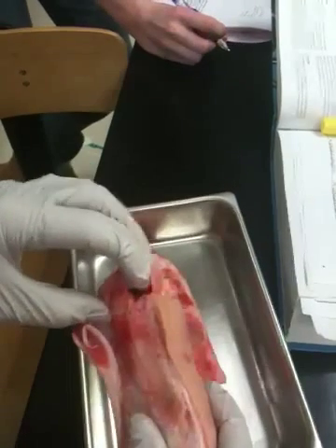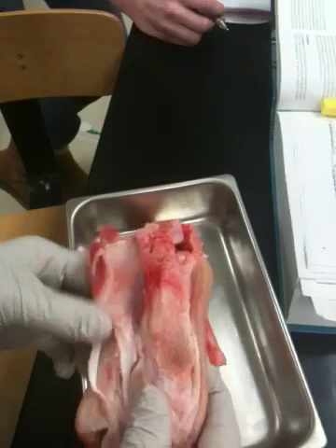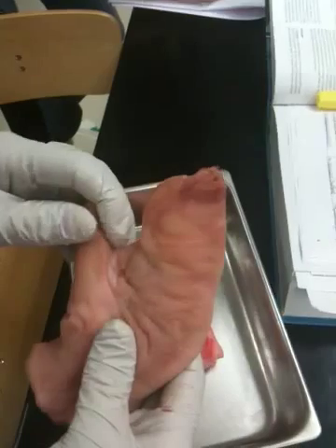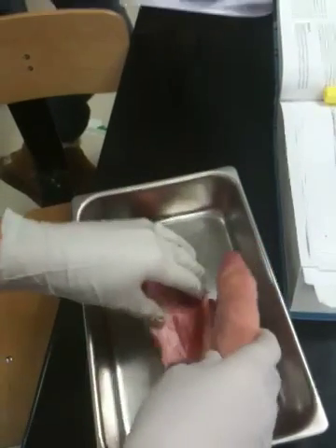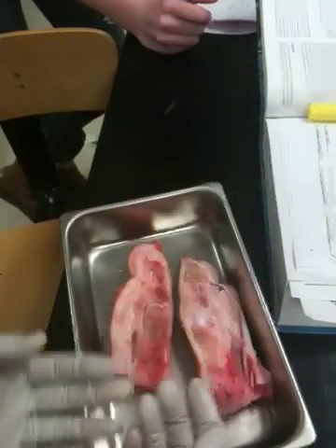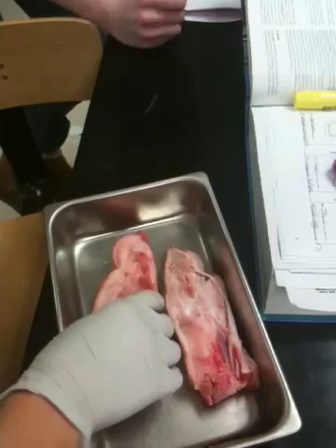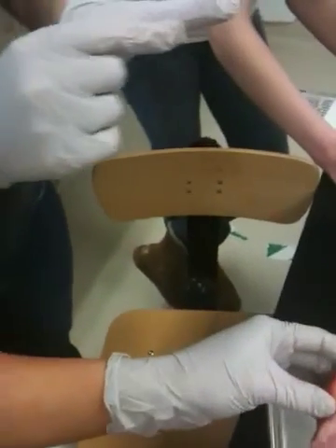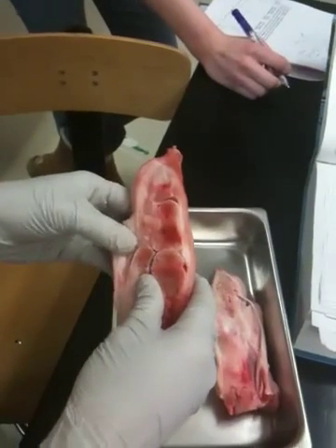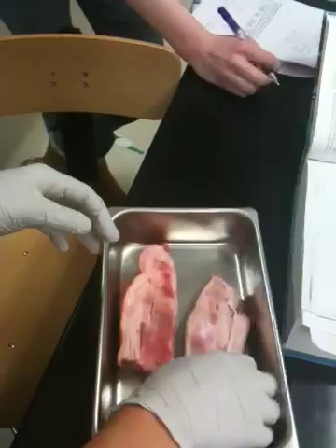This is the same thing. Now this one is a little different — this is a foot, so think about our foot: we have our ankle bones, or tarsal bones, and then metatarsals and phalanges. Theirs is a little modified — our phalanges have three joints, whereas theirs are a little different. That's why it's not the exact same as a human bone, but it's pretty close.